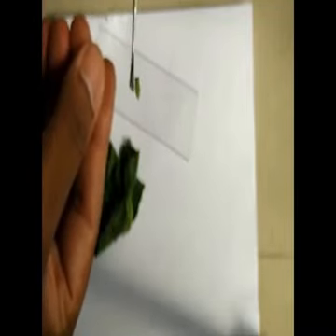Also the stomata are present solely in the epidermal part. Add 1 or 2 drops of water with the brush and place a cover slip over the slide with the help of a dissecting needle from one side towards the other, so that minimum air bubbles are present.